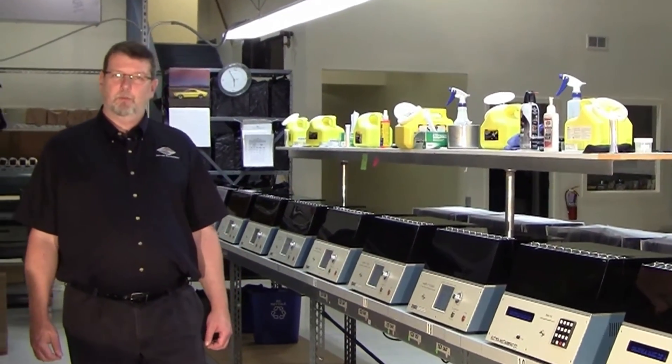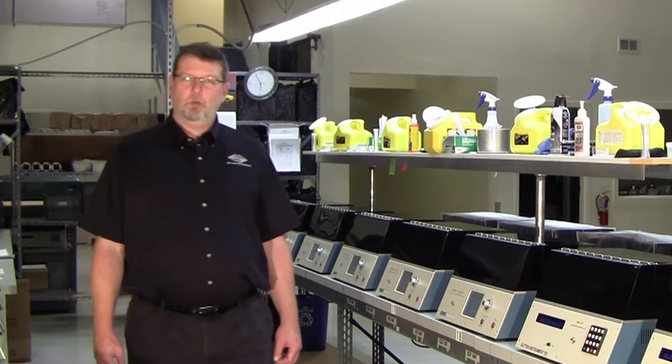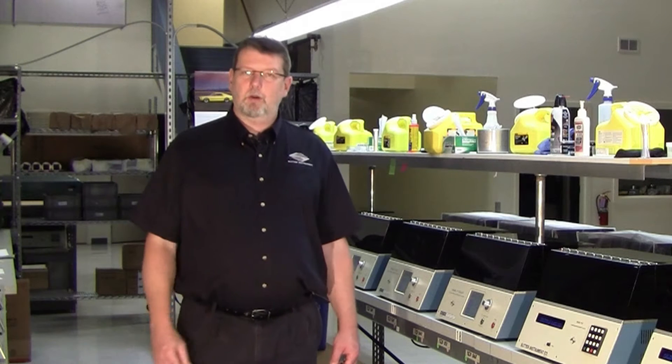Hello, I'm Jan Dolzer at SUTTER Instrument. Today we'll show you a short tutorial about checking the correct function of the pulleys on your SUTTER horizontal puller.